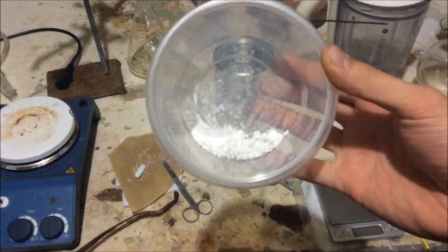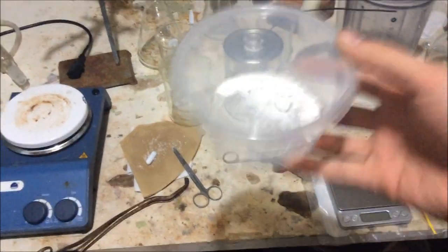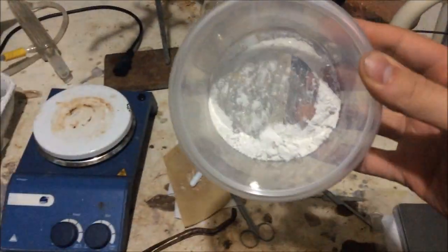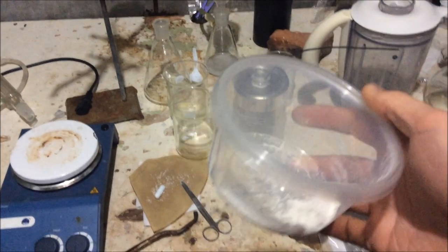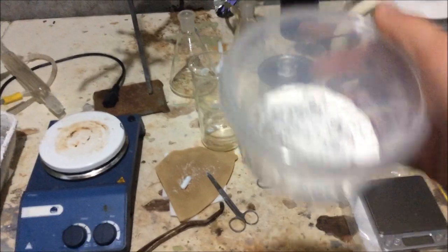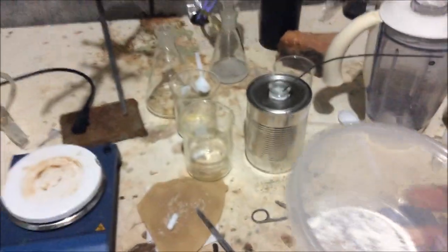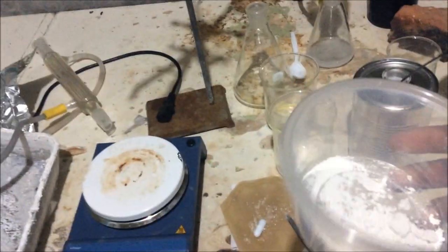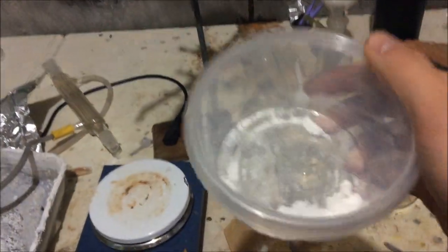And here is our final product of a few grams of terephthalic acid. So I filtered it out, washed it with water a few times to get rid of all the other impurities. And then I washed it with methanol to help it dry, which resulted in a bit of a loss. You can see it down the bottom. But I don't actually need this for anything, but this is the point of the video.